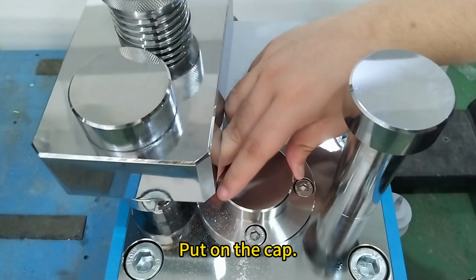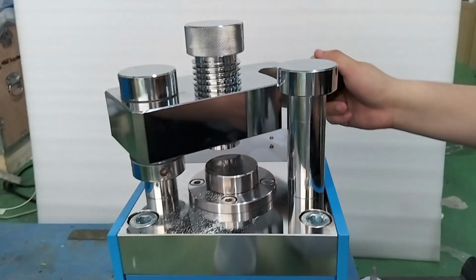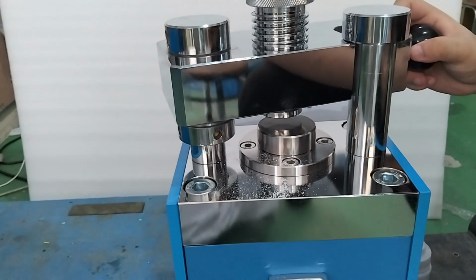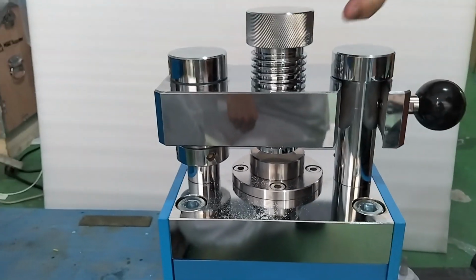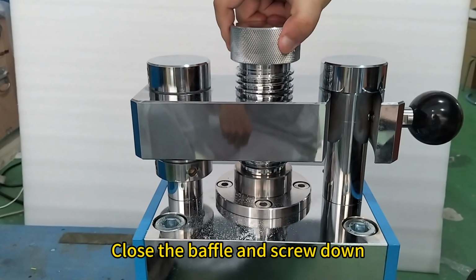Put on the cap. Close the baffle and screw down.